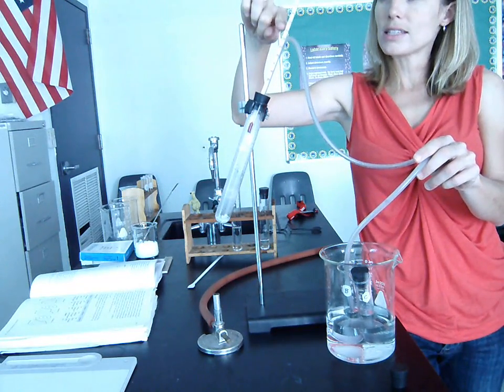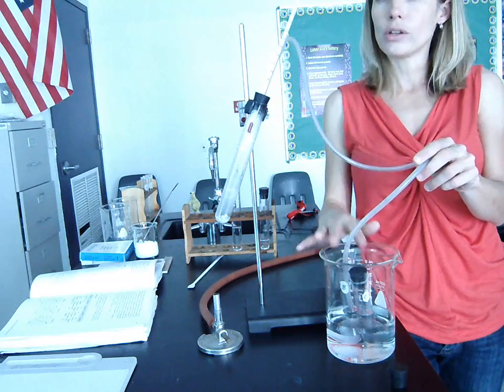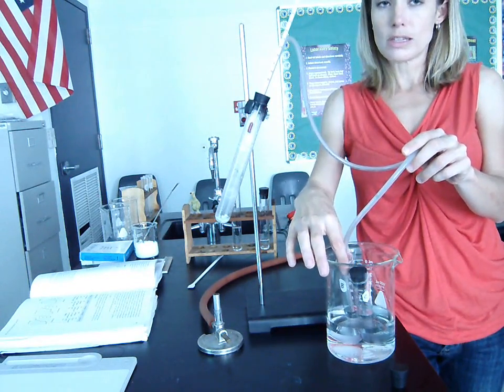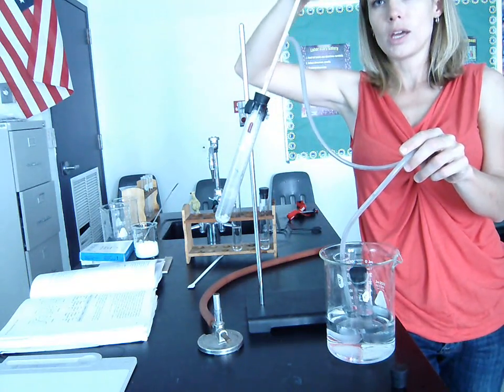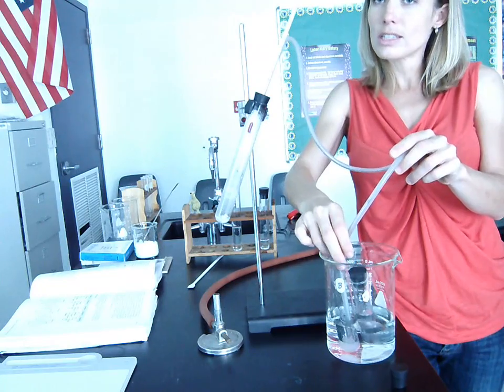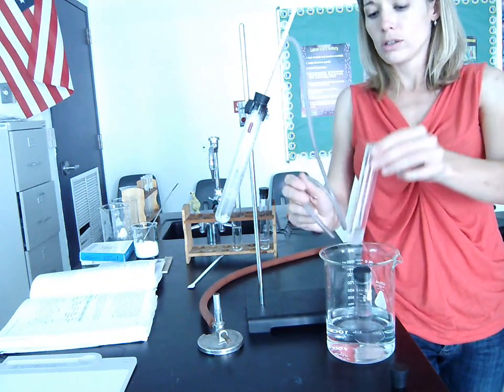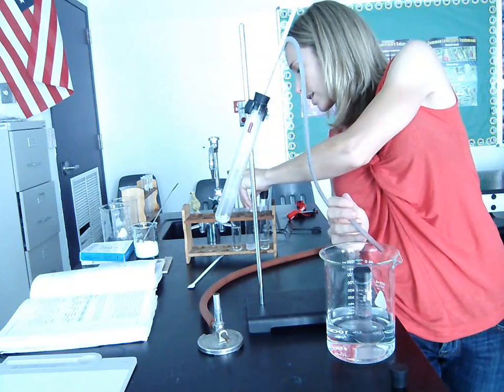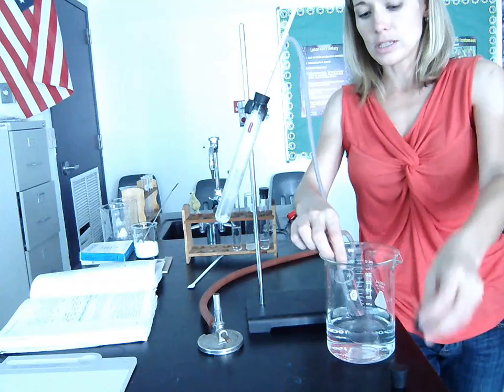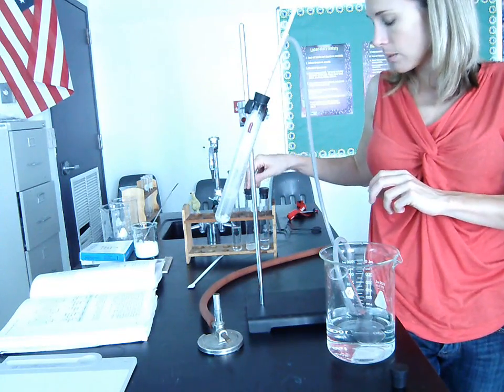Now, at this point, the temperature is going to continue to go up. The temperature rises steadily from 80 to 100 at this point. There's no plateau. So we plateaued at 80, and then we move the delivery tube to the second test tube once the temperature goes up. The temperature continues to rise steadily until we get to 100. Once the temperature gets to 100, we remove the delivery tube from test tube B, and we put the delivery tube into test tube C. And I'll explain test tube B in just a second.